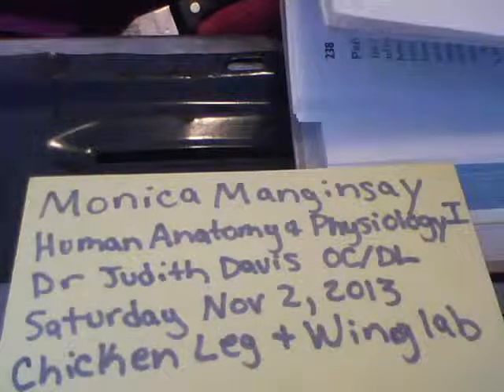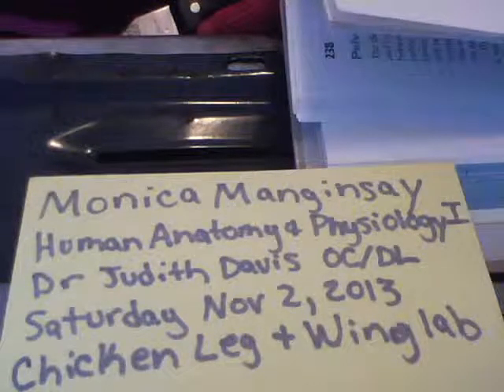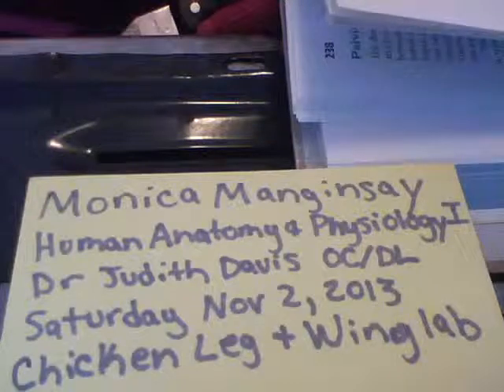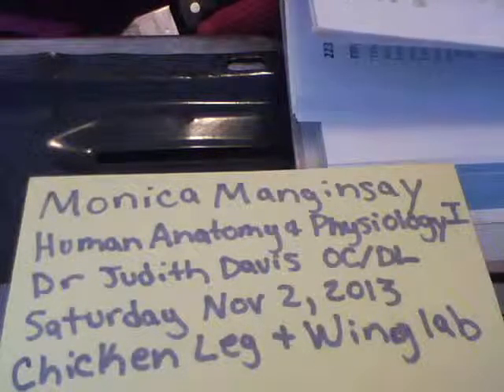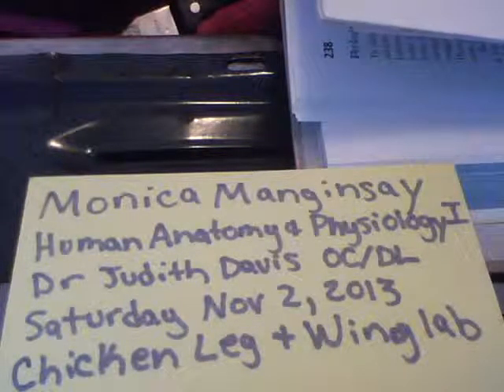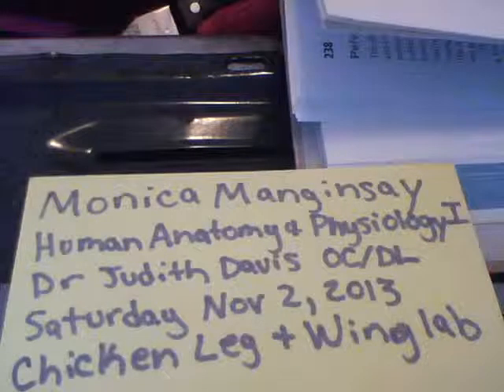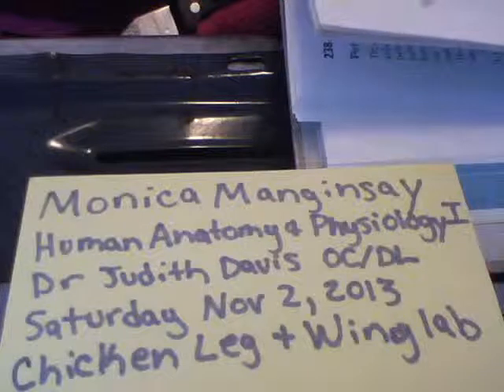Synovial fluid, which is also found within the articular cartilages, provides a slippery, weight-bearing film that reduces friction between the cartilages. Without this lubricant, rubbing would wear away joint surfaces, and excessive friction could overheat and destroy the joint tissues, essentially cooking them. The synovial fluid is forced from the cartilages when a joint is compressed.